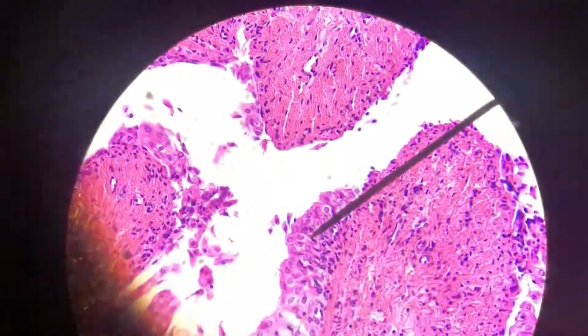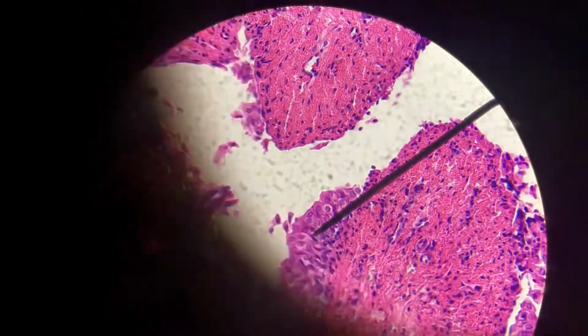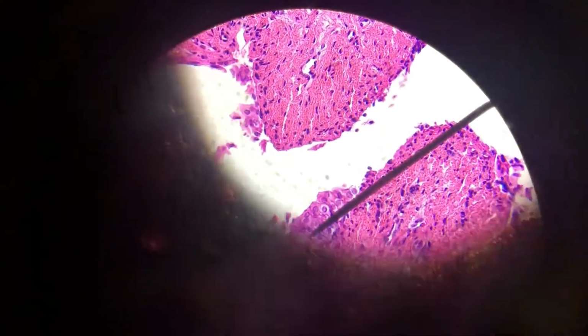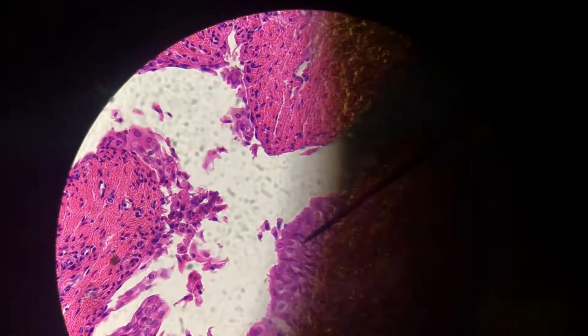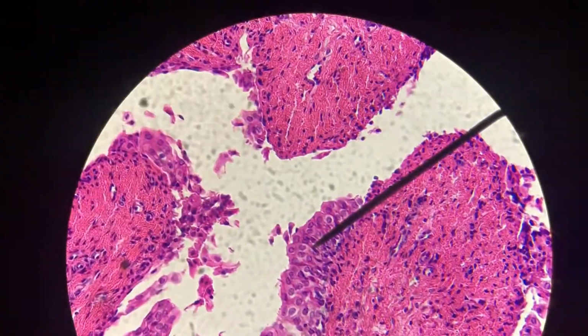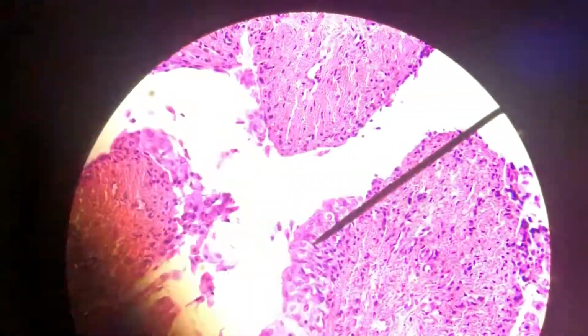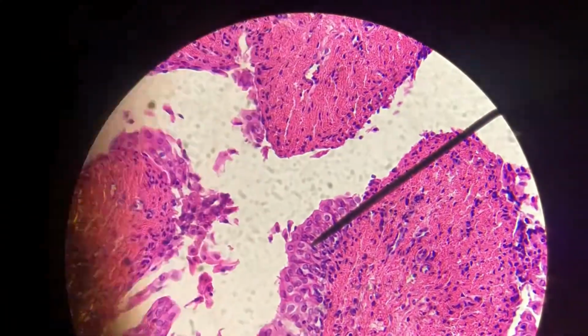But look, see how they kind of look cuboidal right there? Well, not even really. They just look circular. So you don't see stratified tissues like that anywhere except in the bladder where we've got transitional epithelium. And so this must be an empty bladder. As it fills, those cells will stretch out and become more squamous looking. And you would also see these folds stretch out so that instead of these little gaps of white, we'd have a big open white space that was full of urine.